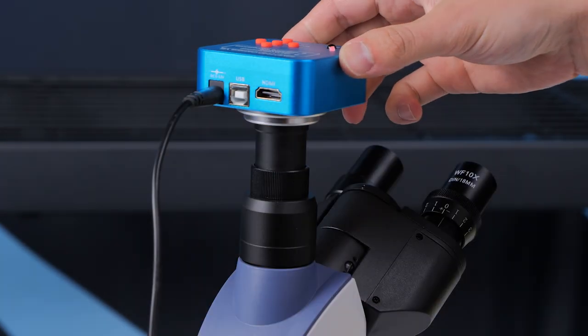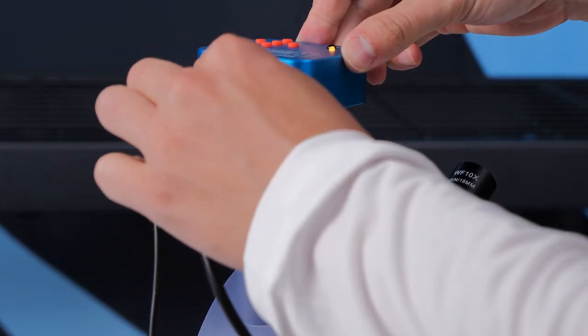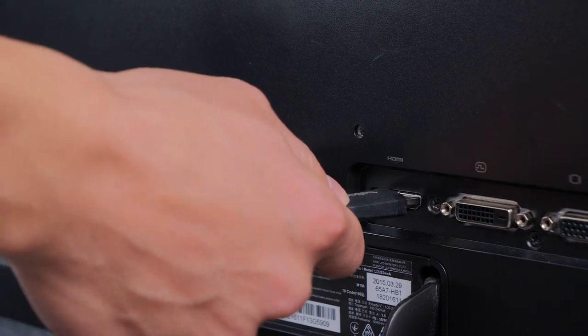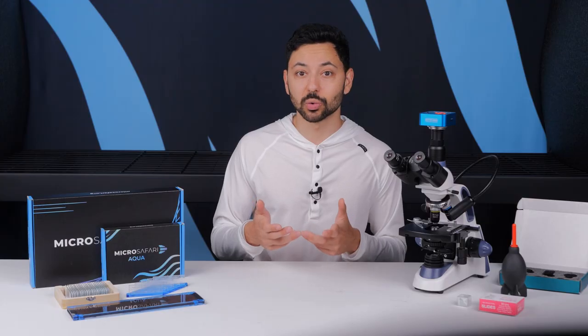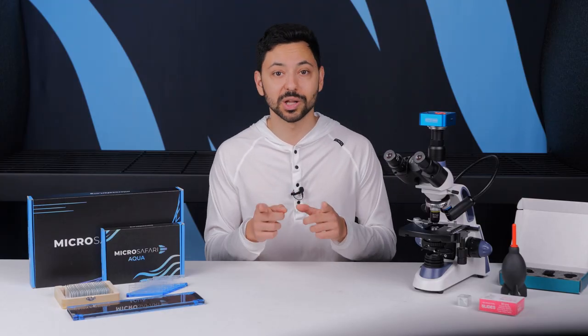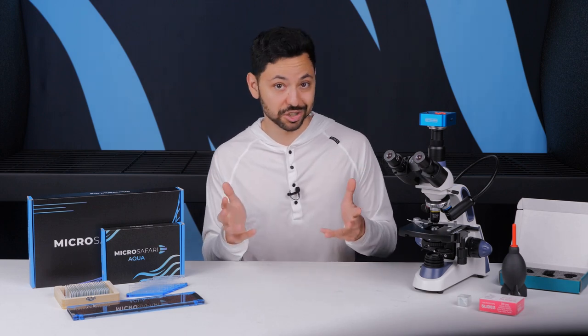Plug in this power supply and plug one end of the HDMI cable into your camera and the other into a TV or monitor. If you're using a TV you may need to switch the source over to whatever HDMI port you've plugged into. It should just work though.